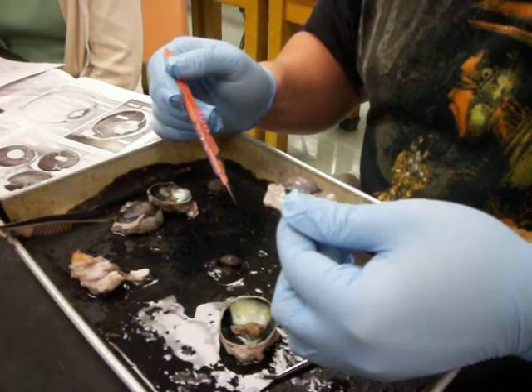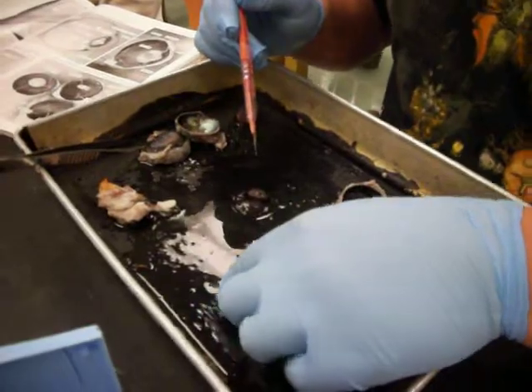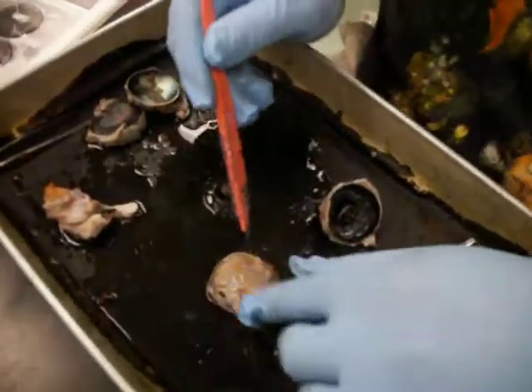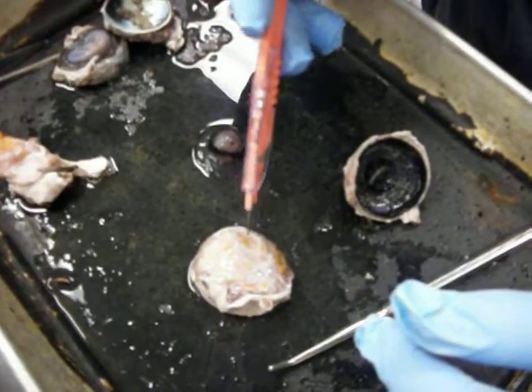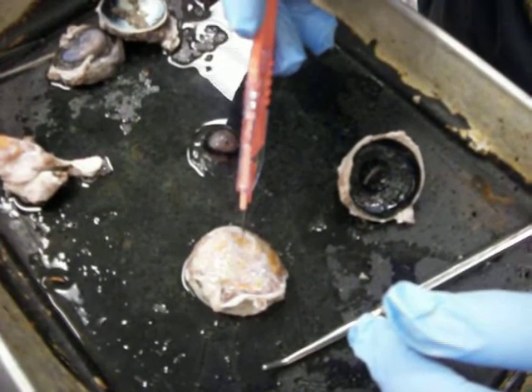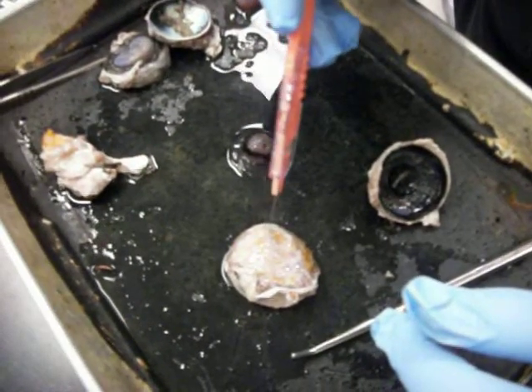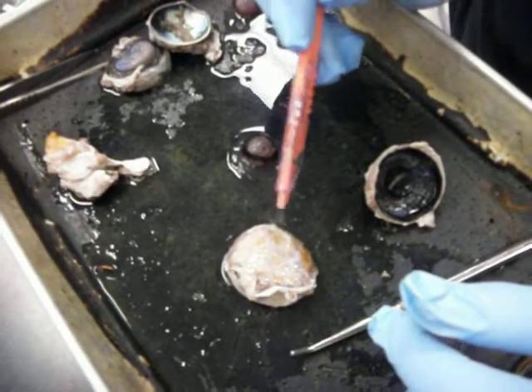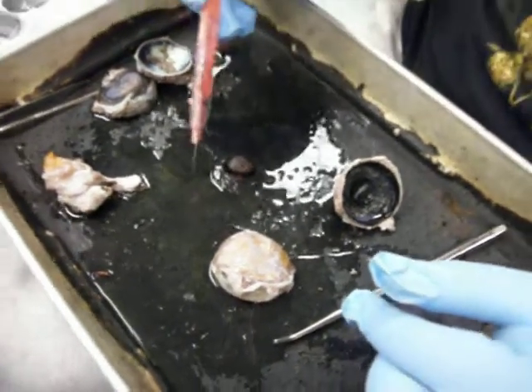Did we hit everything? Oh, the brown spot on the outside of the eye, which is right here, this little circle. Don't get it confused with the adipose. Yeah, the adipose is orange. So this little brown spot right there, that is the CN2 optic nerve, and it is on the back outside of the eye. We missed the sclera, I think.